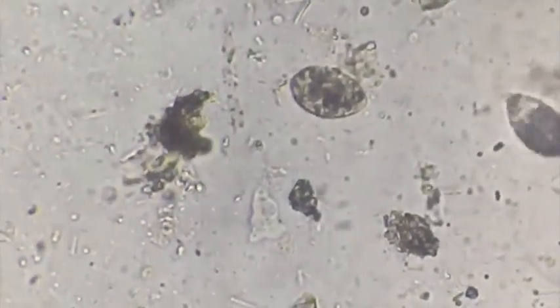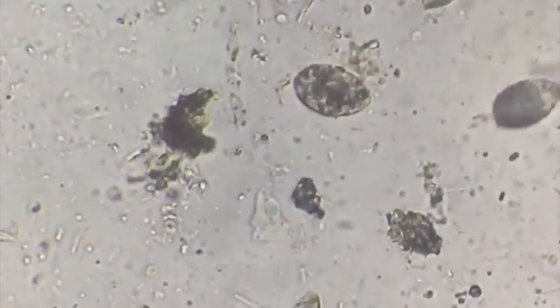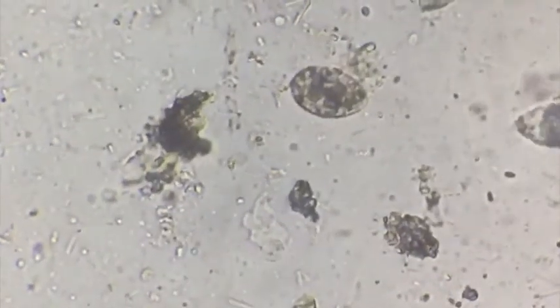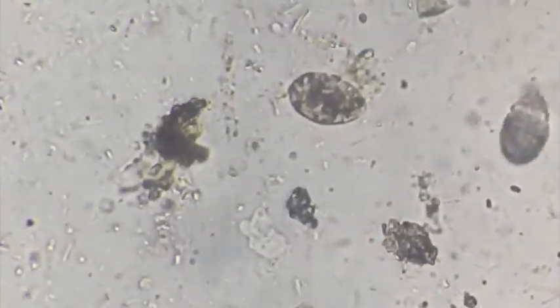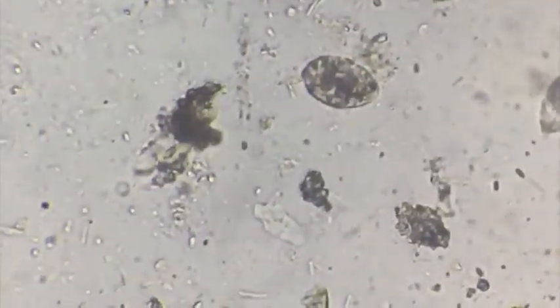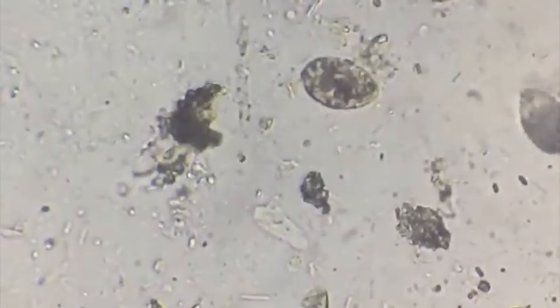There are other species of microbes also that you can see very clearly in this frame.